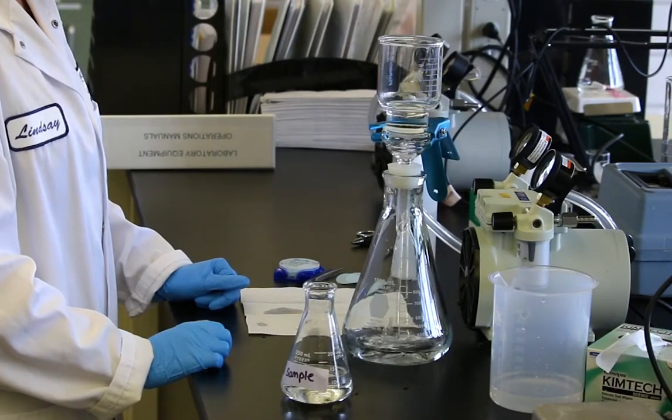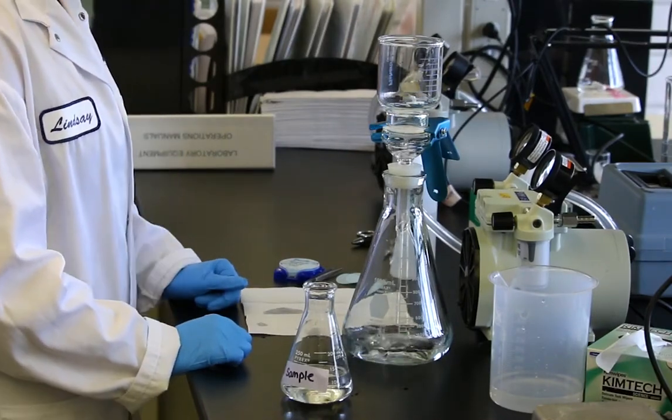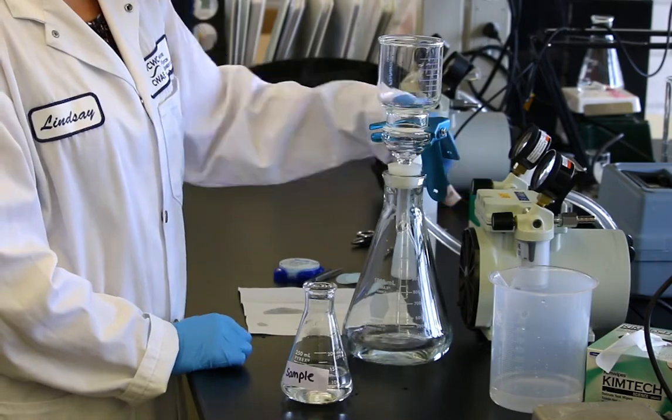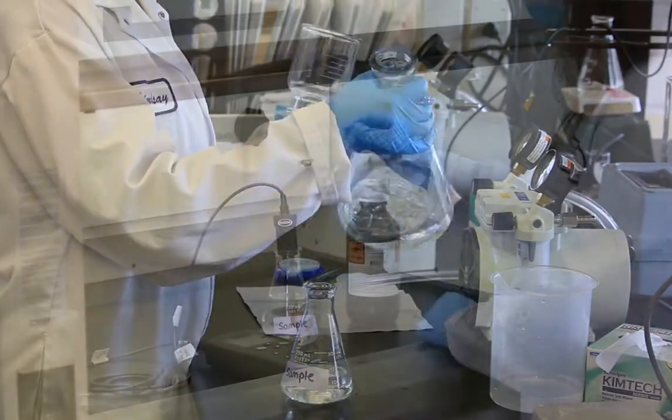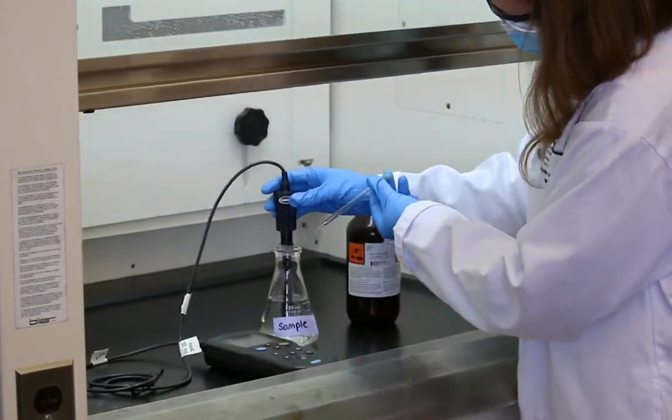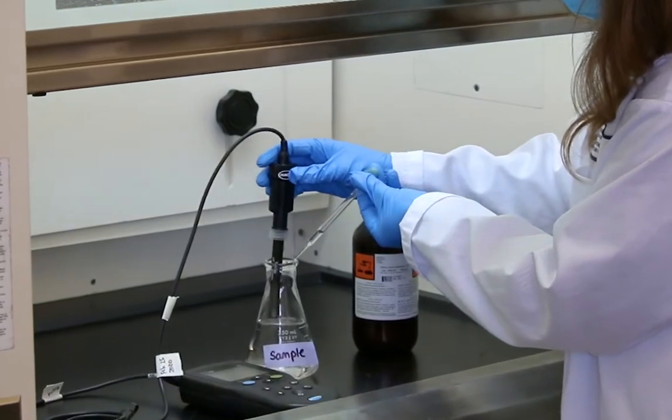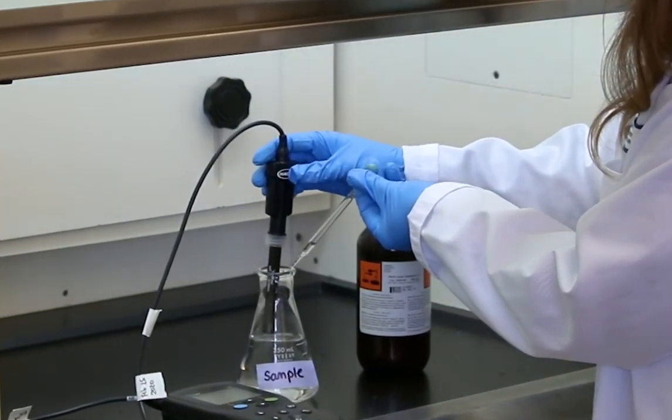If you only want to measure dissolved iron in the sample, filter your water immediately after collection. Samples can be acidified for later analysis and stored up to 6 months. Please refer to your method for instructions.